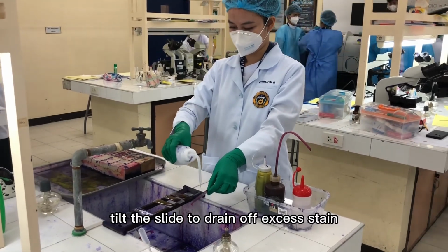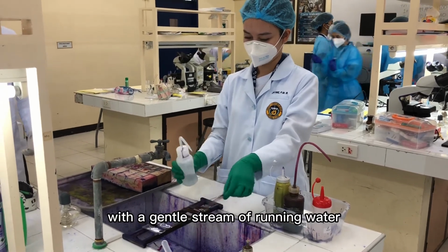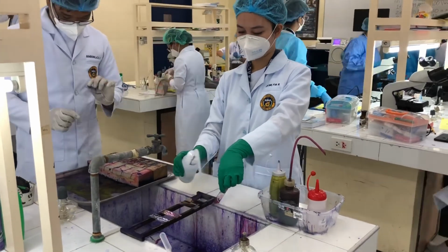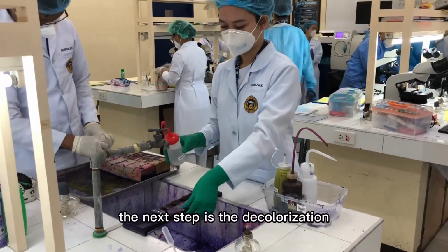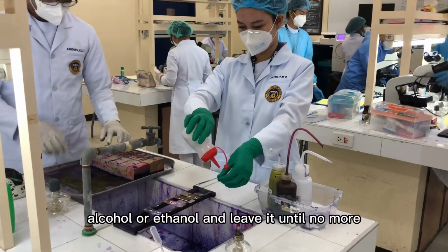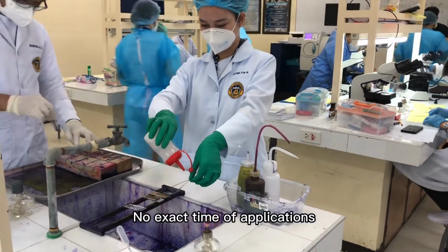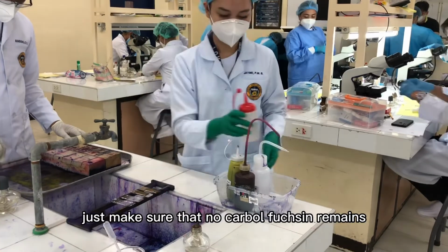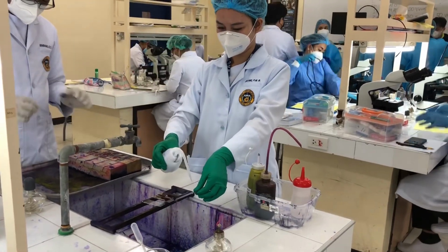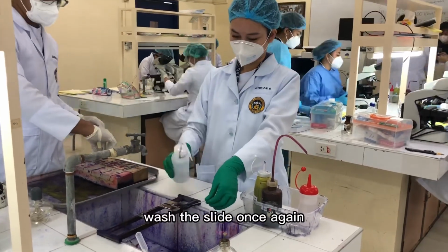Tilt the slide to drain off excess stain. Wash the staining solution off with a gentle stream of running water. The next step is decolorization. Pour the whole slide with acid alcohol or ethanol and leave it until no more color drains from the smear. The exact time of application varies, just make sure that no carbol-fuchsin remains. After the application, wash the slide once again.